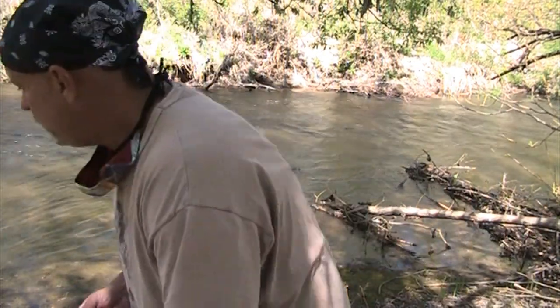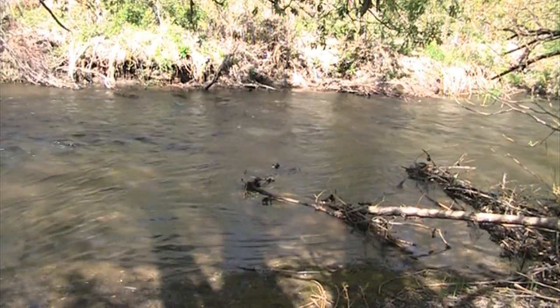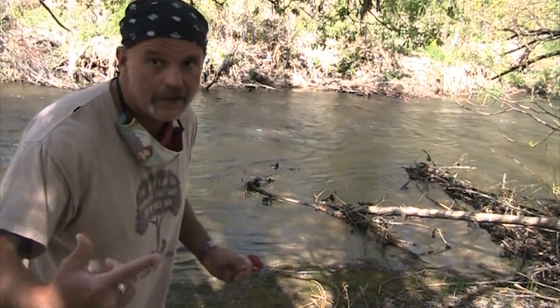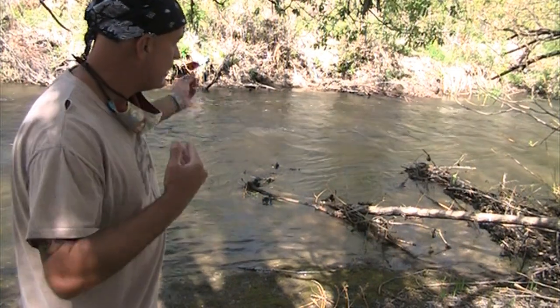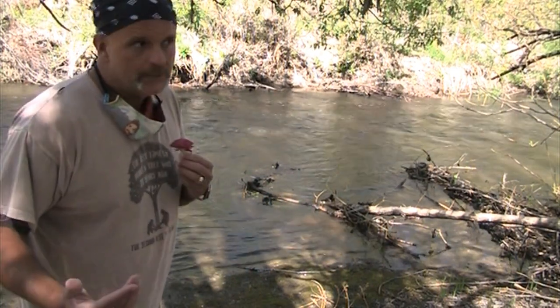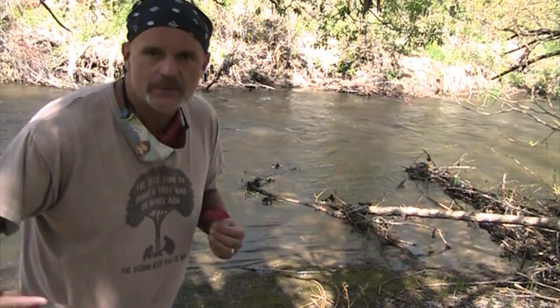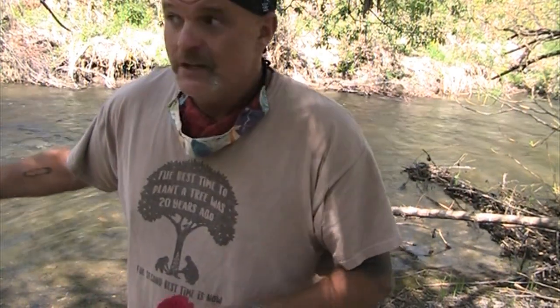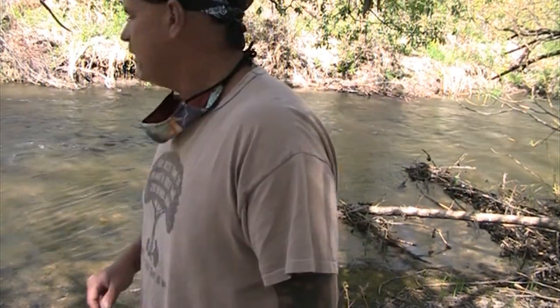But to measure stream flow, all you have to do is toss that in the river and then have someone keep an eye on it and see when it crosses a pre-established point. Cool thing with stream flow is the faster the water is moving, the more dissolved oxygen you have. The reason why is that it increases air exchange, especially if you have rapids like I have. It's a tiny rapid. We'll just call it a rapid because it's not plural yet. Once you start seeing white water, dissolved oxygen is going up. And we can just measure the stream flow again. Yep, it's still flowing.